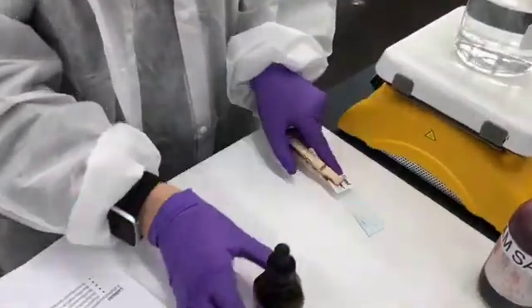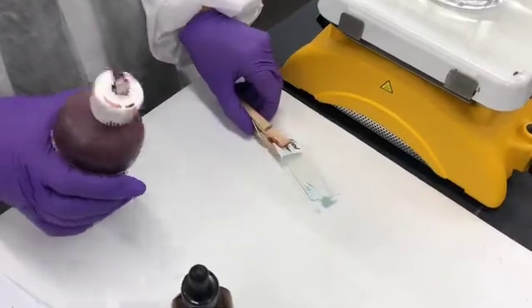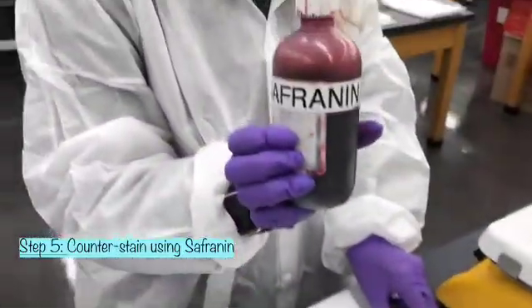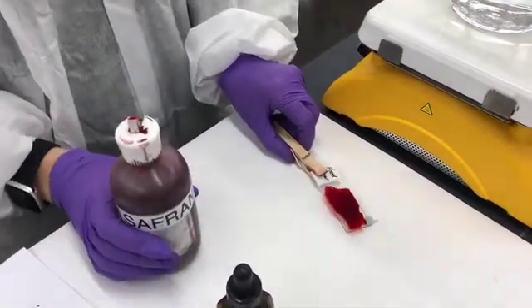And then we have our second and final step, which is known as the counter stain. Safranin. Apply the dye on here for 30 seconds.